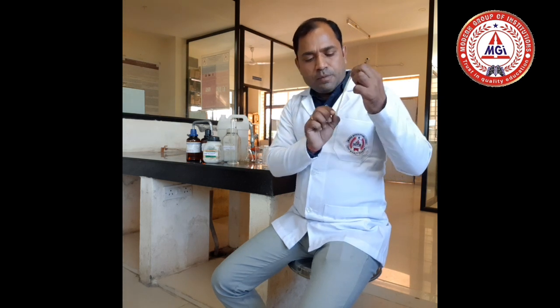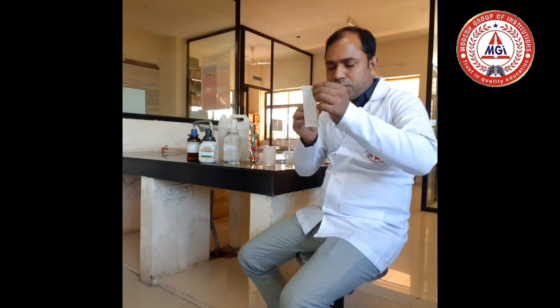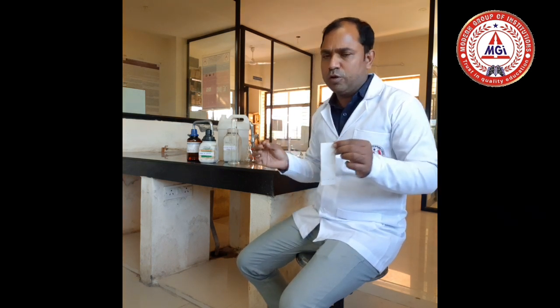The next step is to cut a Whatman filter paper of rectangular size. Mark a straight line one centimeter from the bottom and mark three spots where you are going to put your samples. Your samples include three: one standard glucose, second standard lactose, and a third test sample which is a mixture of both. With the help of a capillary tube, mark a small spot on the filter paper. Only a small drop of your sample is needed.